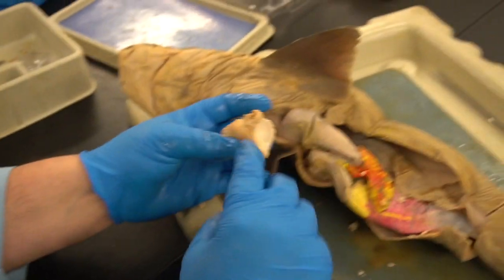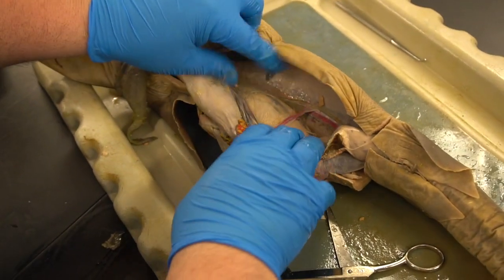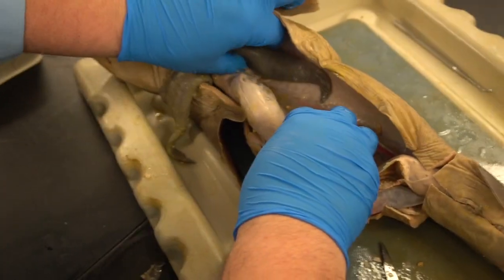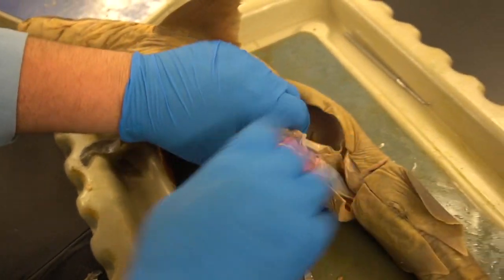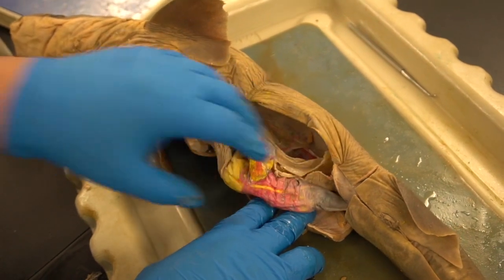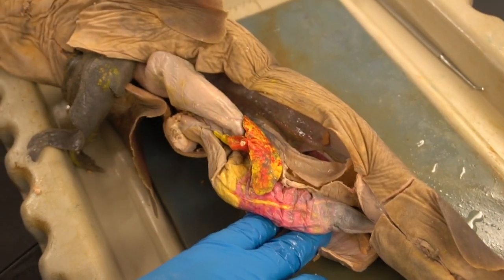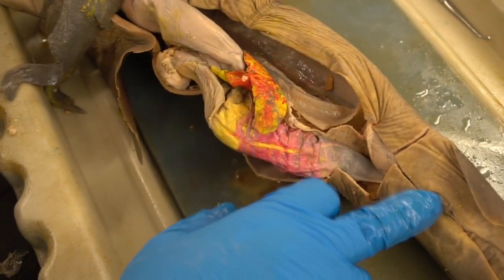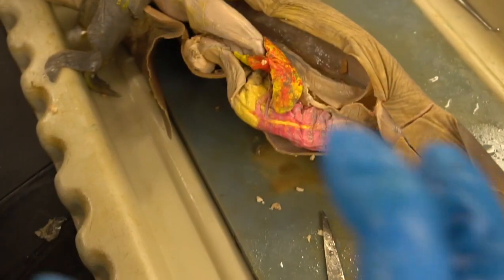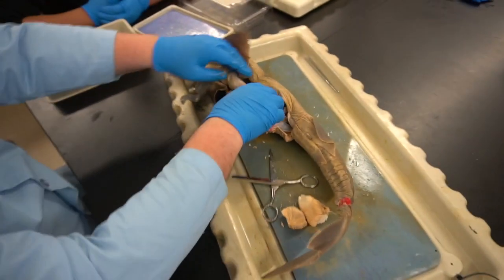All right. So for reproduction of the female, is everyone comfortable with the parts there? Those 3 parts are the important ones. Just wanted to point out that as I pull these organs to the side here, and I flip the liver out, you can see that if you remember back to early lessons, we said that the body cavity we call the coelom has an attachment to the outer body wall somehow. It's a tube within a tube, right? So we have an attachment at the anterior and the posterior for the tube, the mouth, the anus, and then inside where everything sits, think of it like a giant sausage. Everything's kind of sitting inside the casing. All right, so this is the casing.